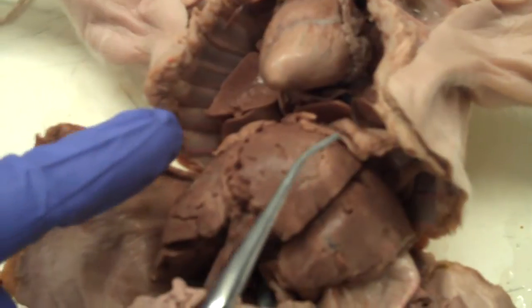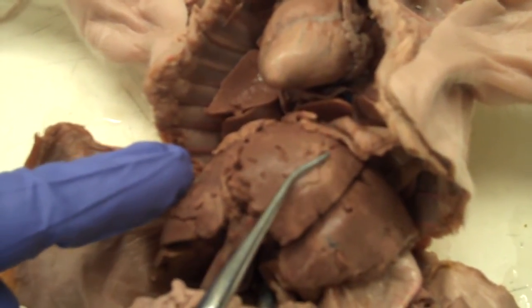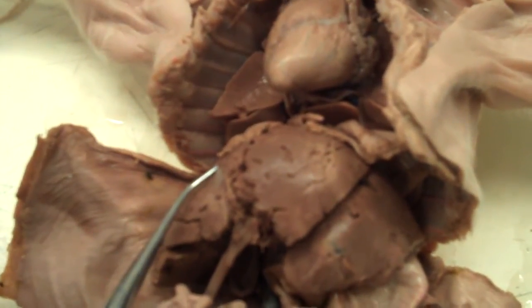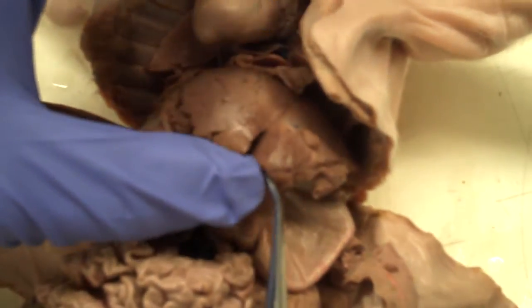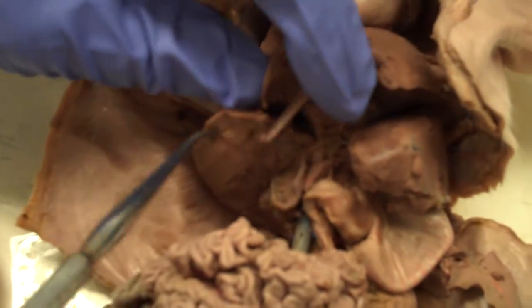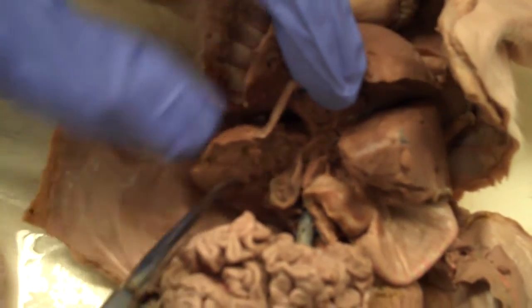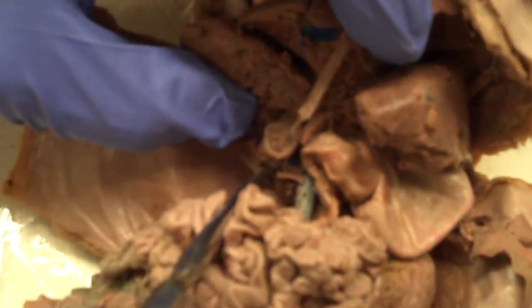We have the medial lobe of the liver — the left medial lobe of the liver and the right medial lobe of the liver — the umbilical vein, the left lateral lobe of the liver, the right lateral lobe of the liver, and the caudate lobe of the liver. Then we have the stomach, the spleen, and the jejuno-ileum.